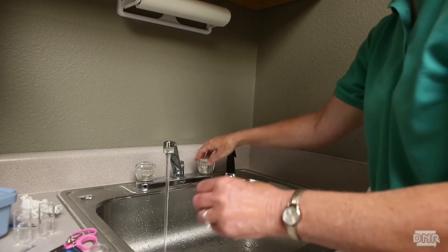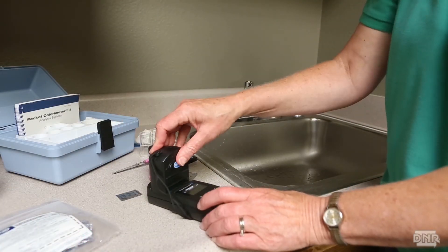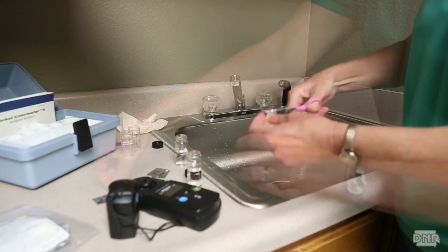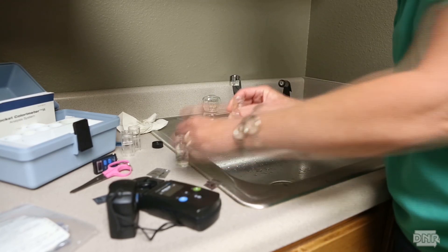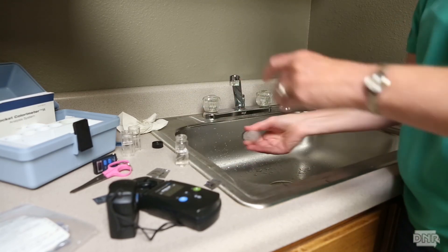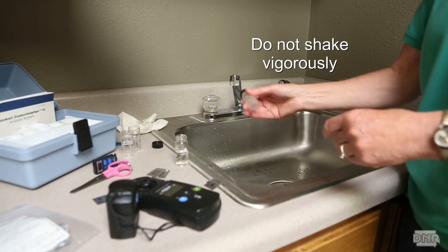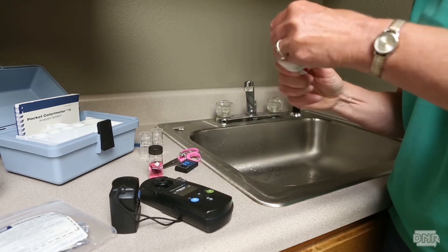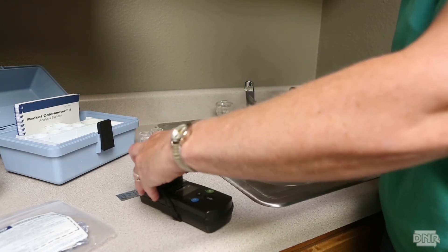To measure total chlorine, fill the sample vial to the 10 ml line. Wipe the vial and place the vial in the instrument. Zero the instrument. Remove the vial, add the reagent, shake to mix, and wait at least 3 minutes, but no more than 6 minutes. Some instruments have a timer, and if yours does, start the timer. After the time of at least 3 minutes, wipe the vial, insert it into the instrument in the same orientation as you did when you zeroed it, and read the value.